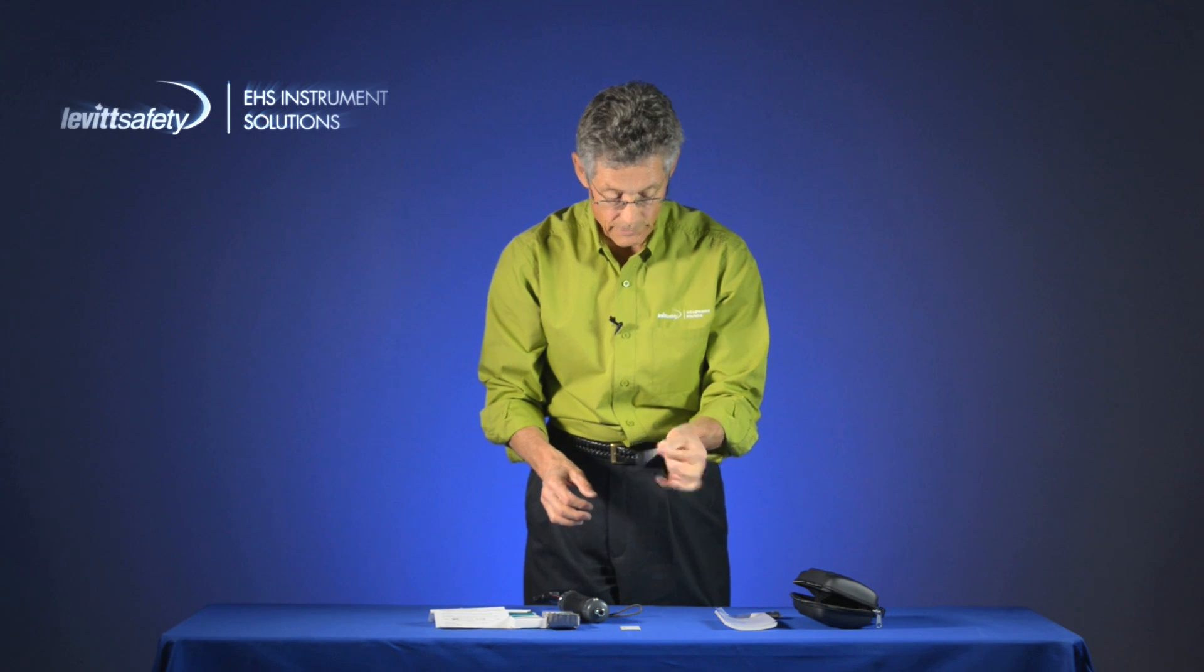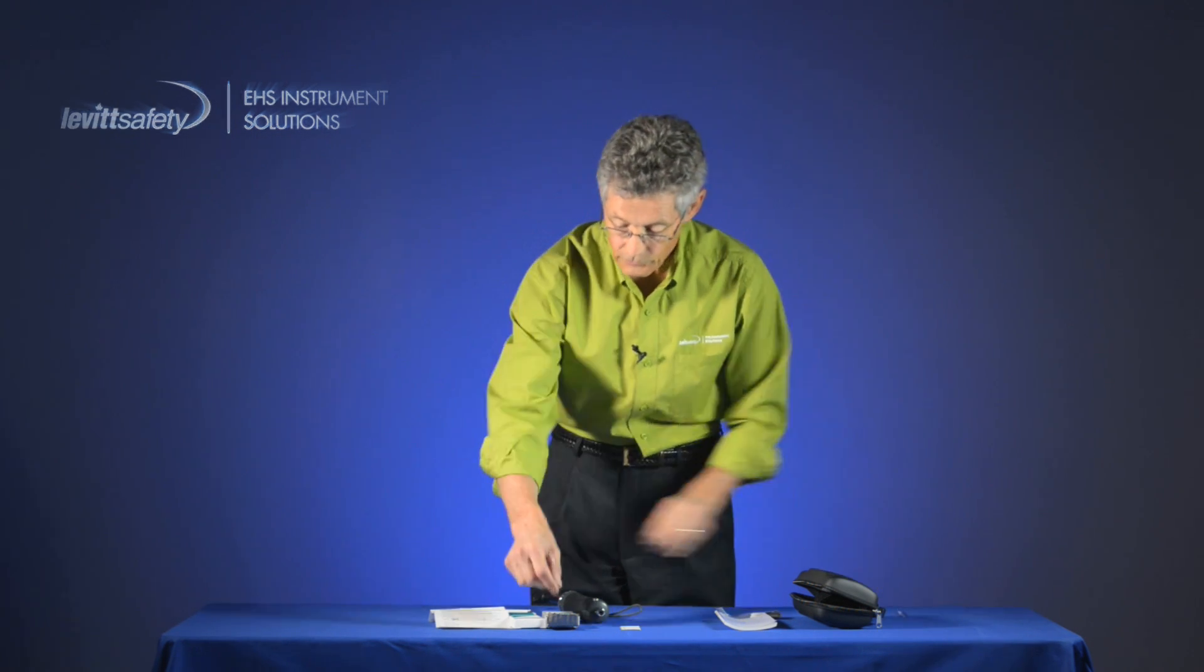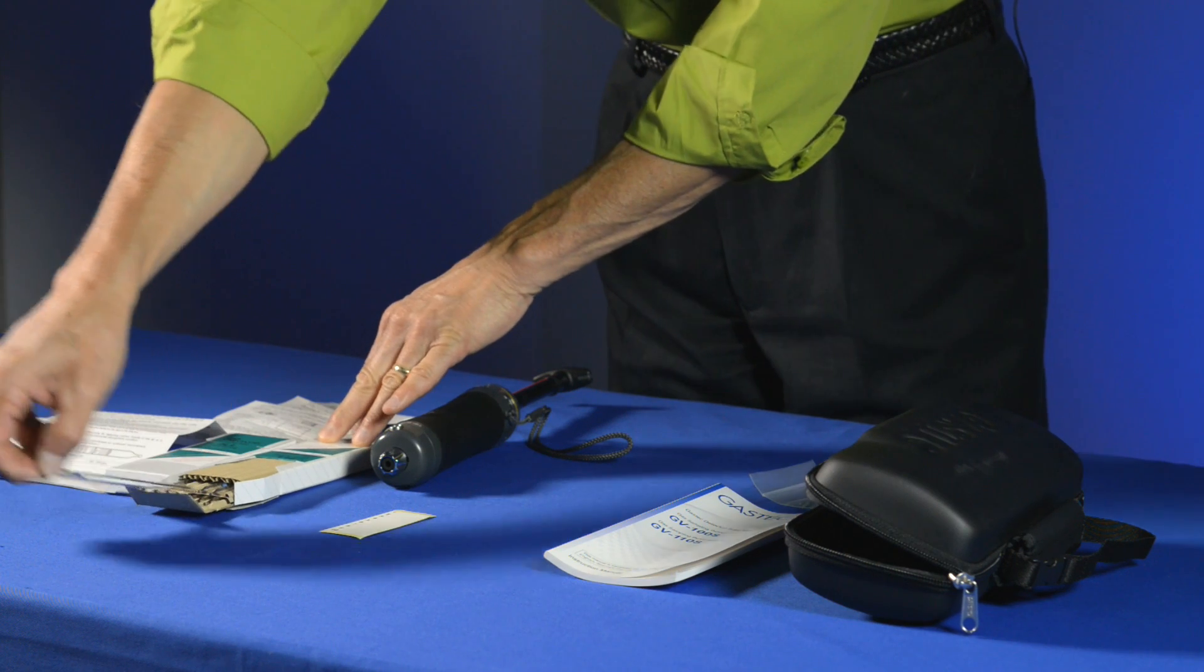So at the end, this tube is done and you can dispose of it and you can do another sample in another location if that's what you want to do. Thank you.